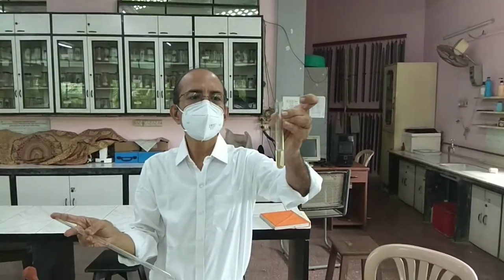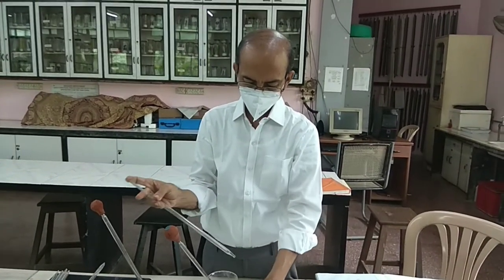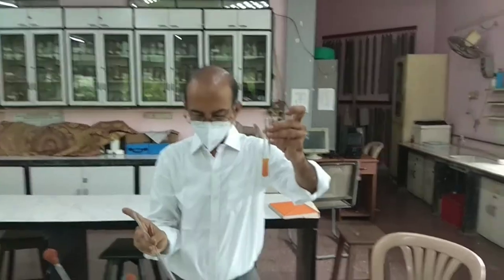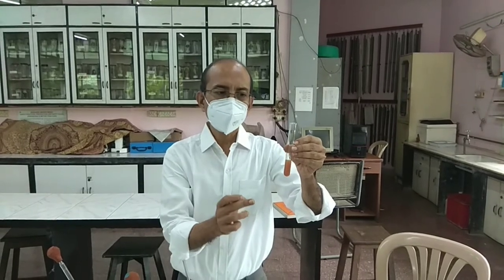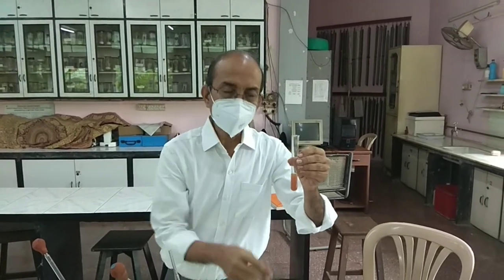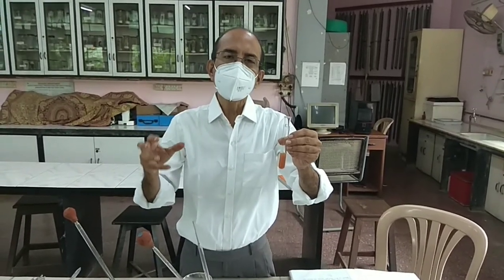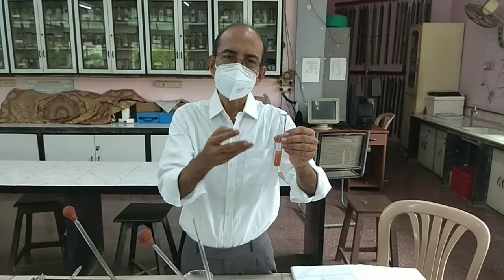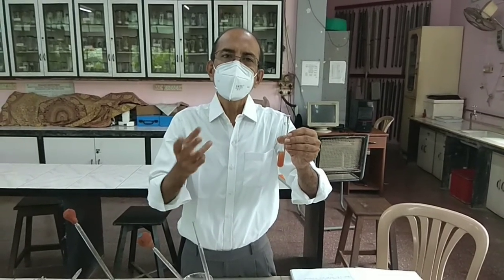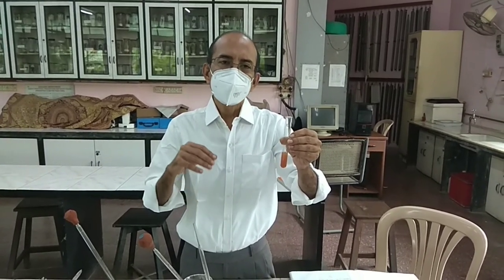We pour Nessler's reagent into C — not much change. When you add it into the experimental test tube E, the presence of ammonia creates an orange coloured complex. Nessler's reagent is comprised of mercury, iodide, and potassium. When combined with water containing even a little ammonia, it forms a dimercuric ammonium iodide complex — an orange coloured dimercuric ammonium iodide complex.